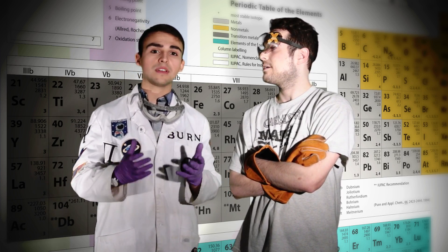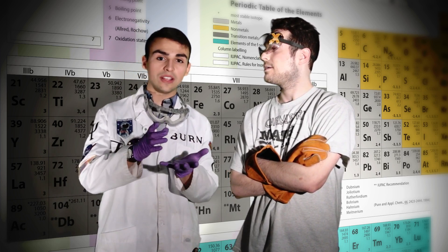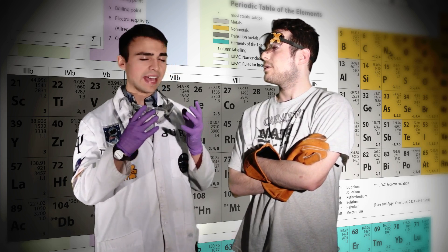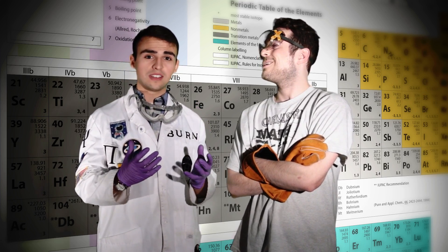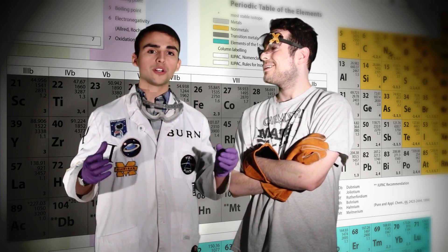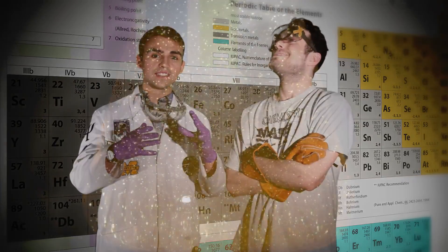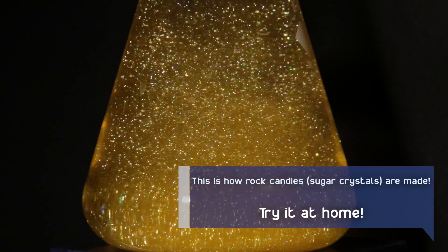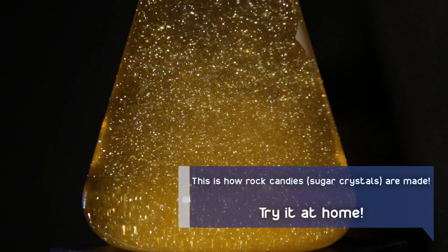Six times? That's a lot. It is a lot. It's so much so that, as we saw in the lab, it became completely clear — all of the lead(II) iodide was able to dissolve. But when we cooled it back down, it had to come right back out of solution. It did so in a pure crystal lattice. This is a purification technique known as recrystallization.